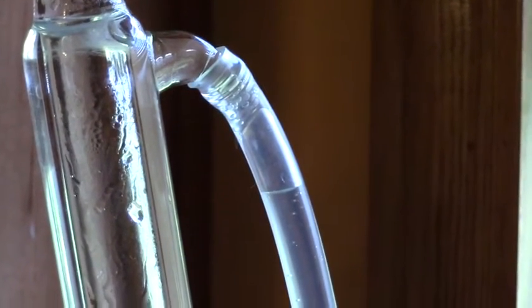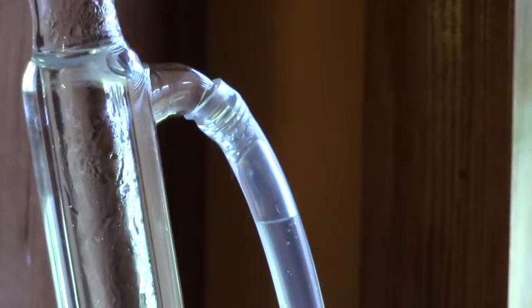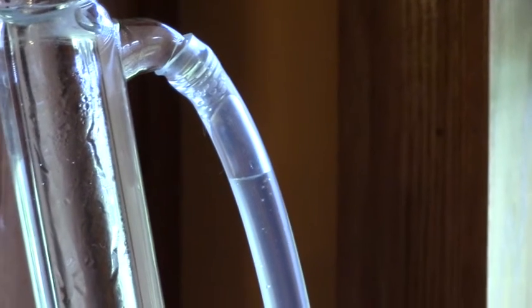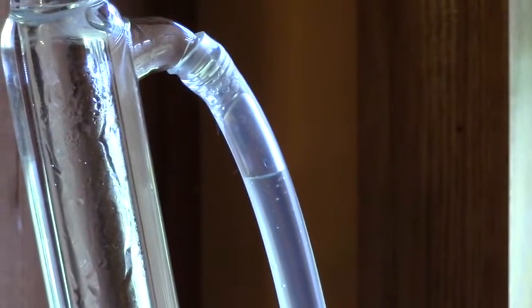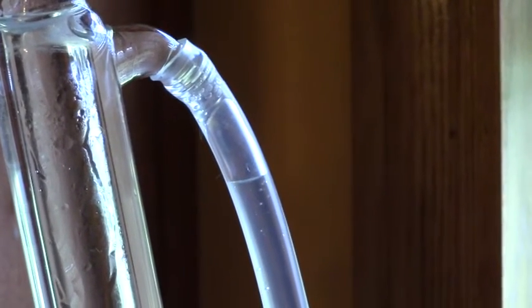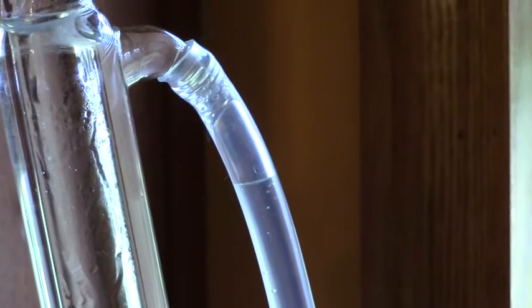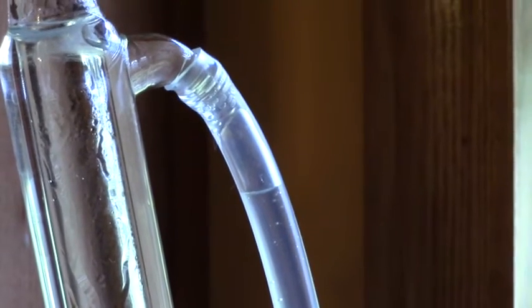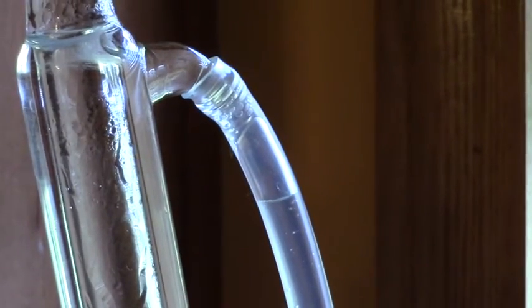The oils drip down the center tube and over to the right the water is dripping down and that's the hydrosol that comes off as the water vapor is collected in a separate container which I'll show you in just a minute. I'm hoping to get a good blast of the hydrosol coming through.